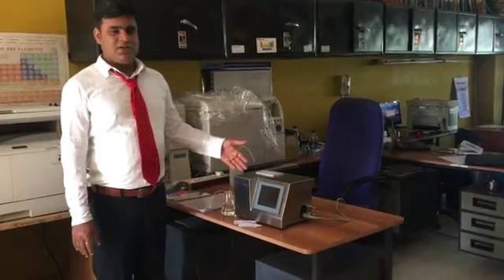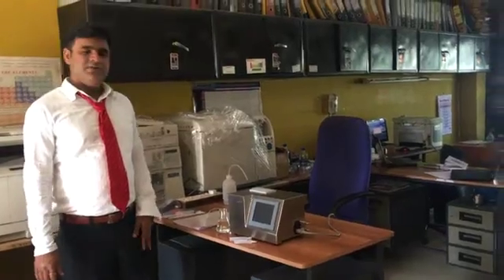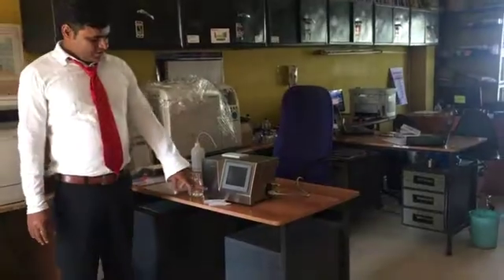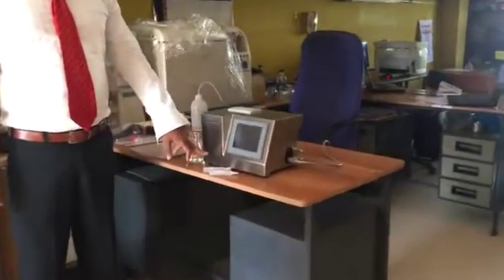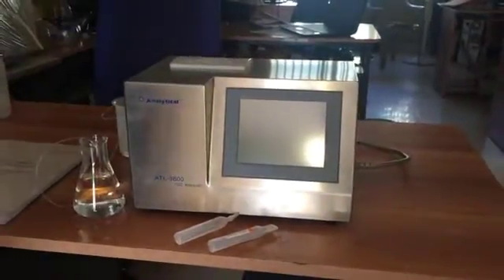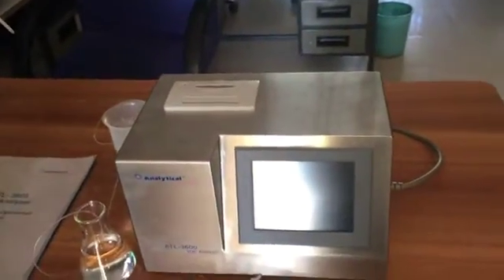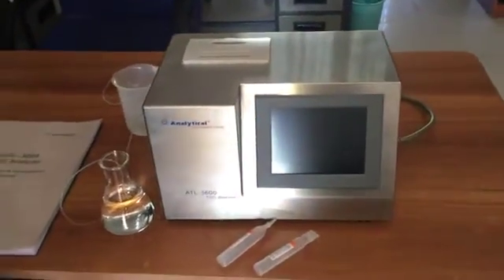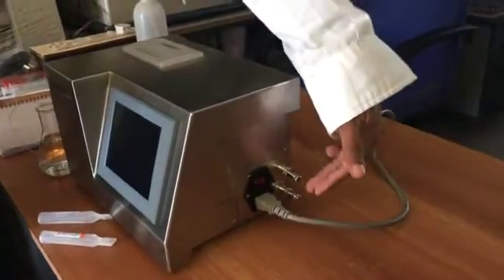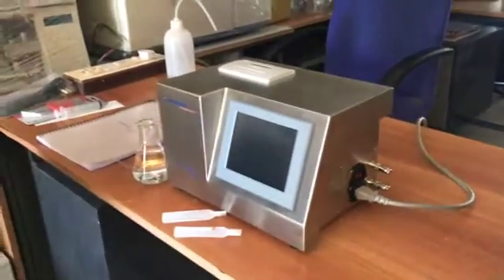Our greatest TOC analyzer for the pure water pharma and biotech industries — this is the Model 3600 TOC analyzer, with a display, touch screen, and a built-in printer. Here is the power cable, and this is the connection for the software output and connection to a computer.